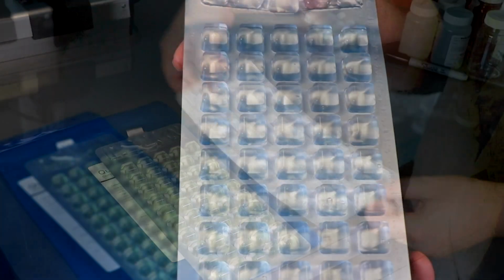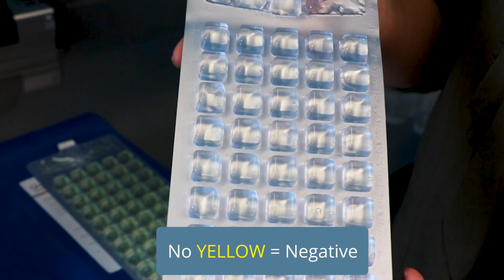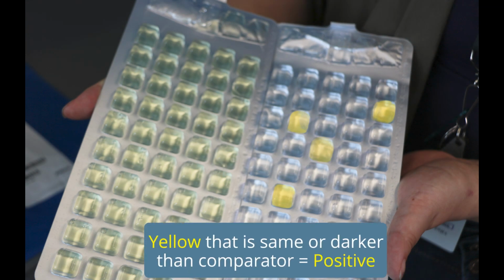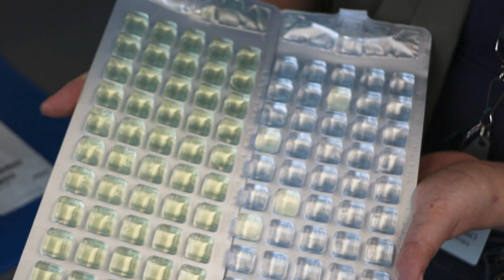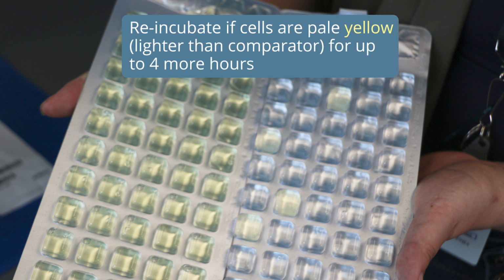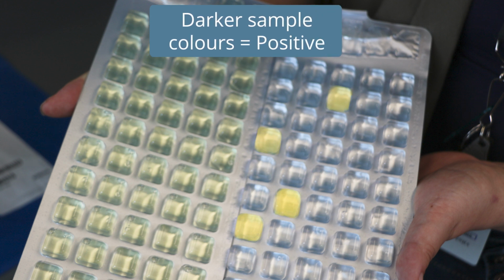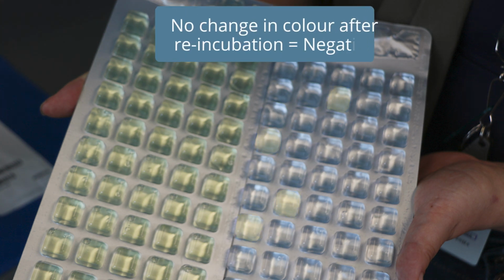No visible yellow means the test result is negative for total coliforms and E. coli. If the sample has a yellow color stronger than or equal to that of the comparator, the sample is positive for total coliforms. If the sample is yellow after 24 hours of incubation, but slightly less so than the comparator, it may be incubated for up to 4 hours more, but no more than 28 hours total. If the sample is positive for total coliforms, the color will intensify. If the sample remains the same, it is negative.